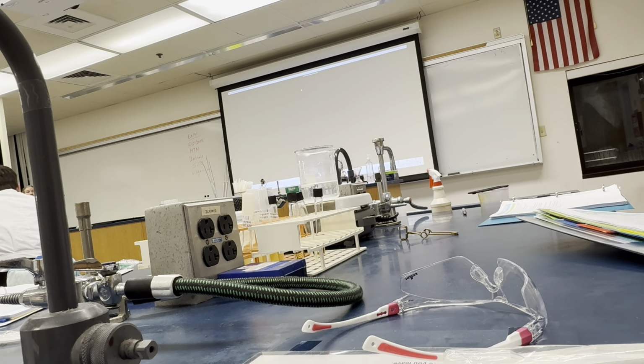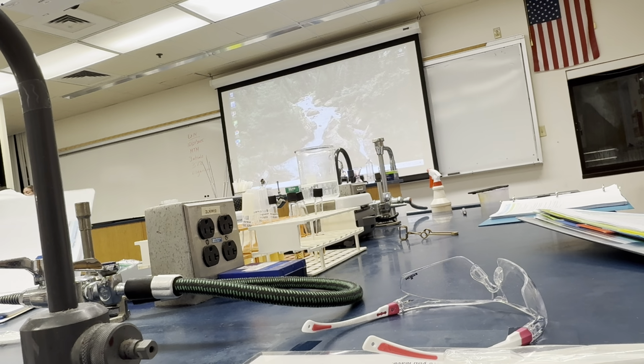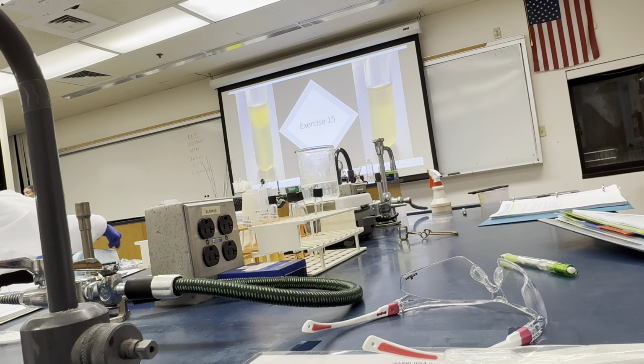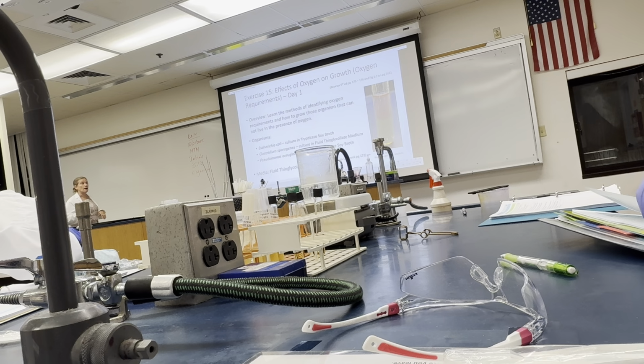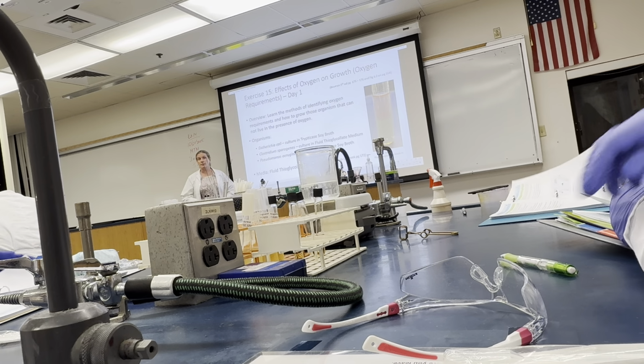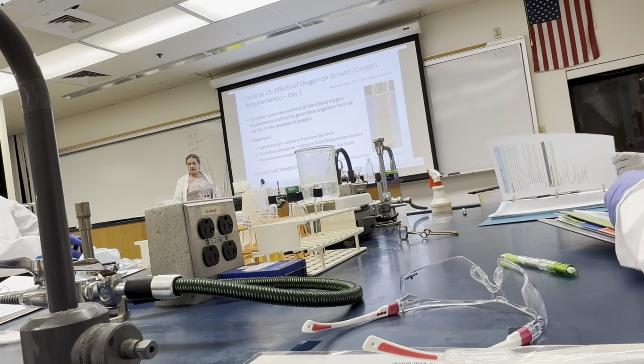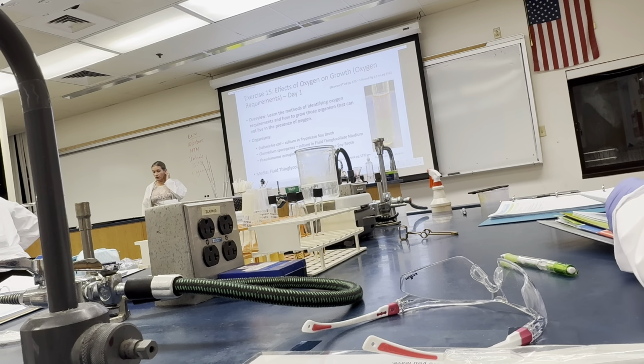These slides, when you're done with the wet mounts, go cover slip and all in the bleach bucket. Don't clean those. The whole slide goes in the bleach bucket. All right, so exercise 15. We're going to be looking at oxygen requirements, which is what we talked about in lecture today. So we're following it through with the experimentation. Lined up just perfectly. It doesn't always happen that way.